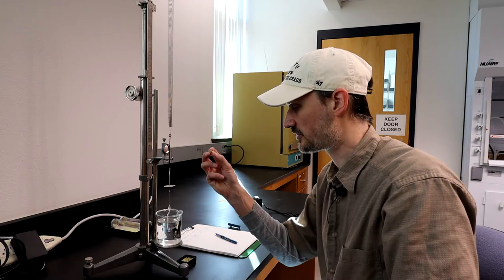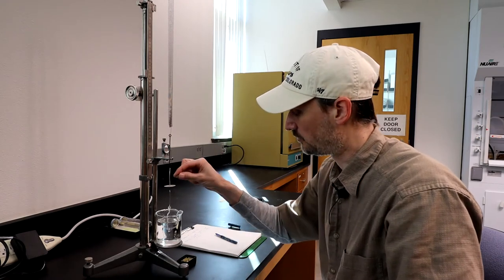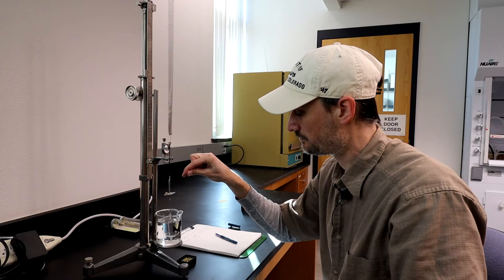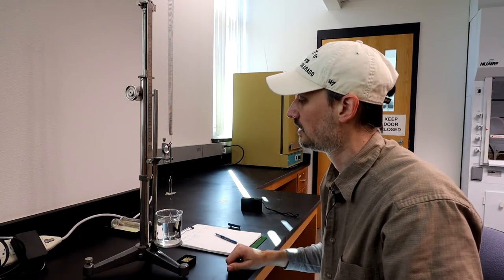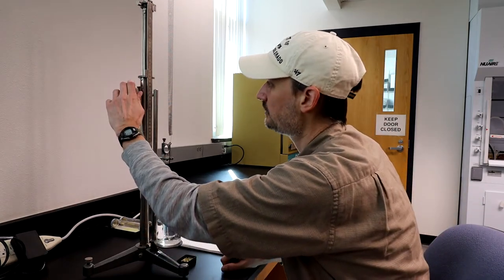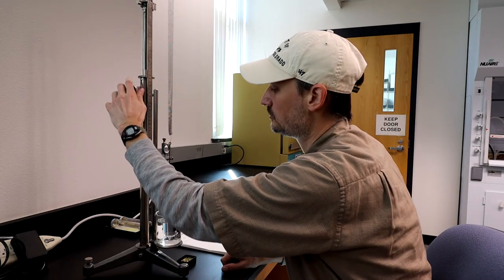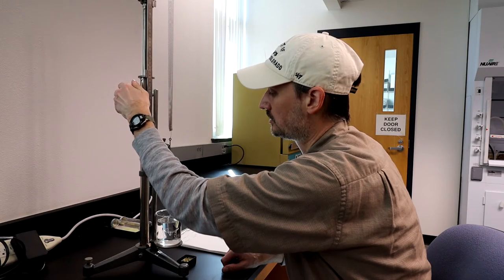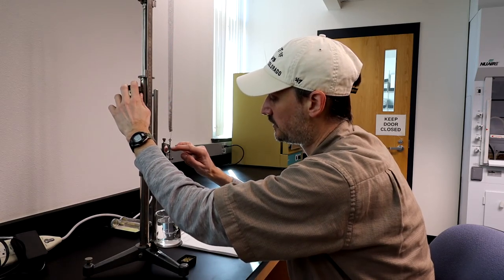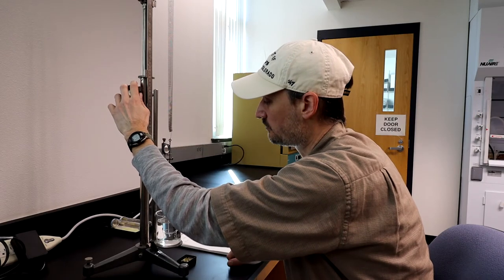Then I'm going to take my first specimen and put it in the upper cup which is in air. You can see it's obviously stretched the spring down, so now I need to move this knob until again the platform is centered with the line which is centered with your eye.